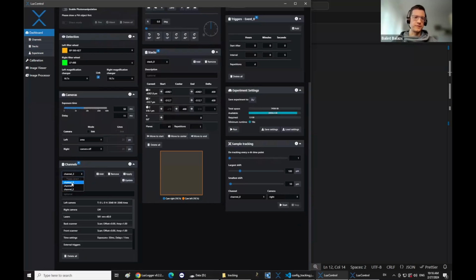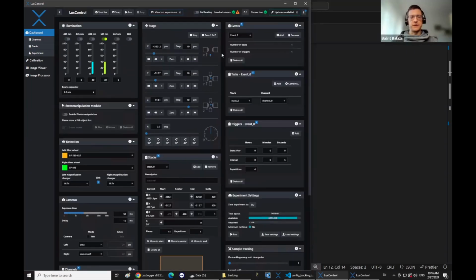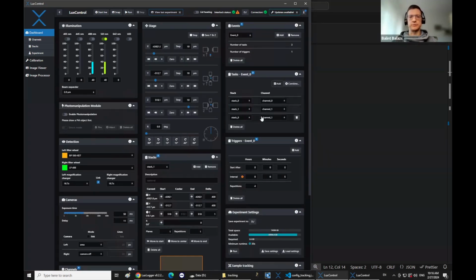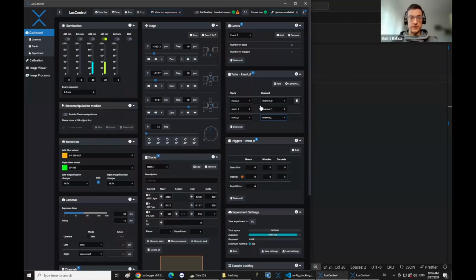I have 3 channels, and then the stack would define the position of the sample that you want to image. And when you set up an event, then you have to basically create these pairs of stacks and channels to define the experiment. So you can have like a series of different stacks and channels. So I just wanted to explain this for the settings, because you can have different channels for the same stack.